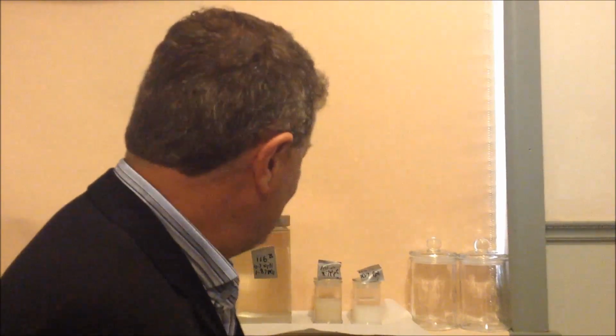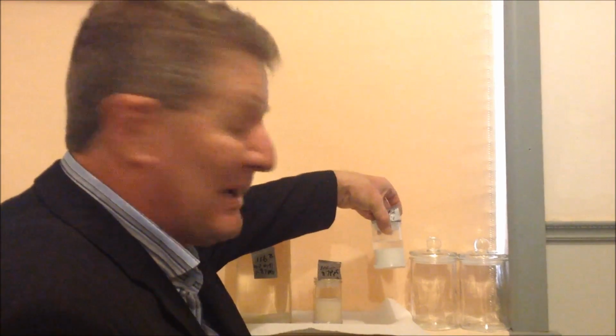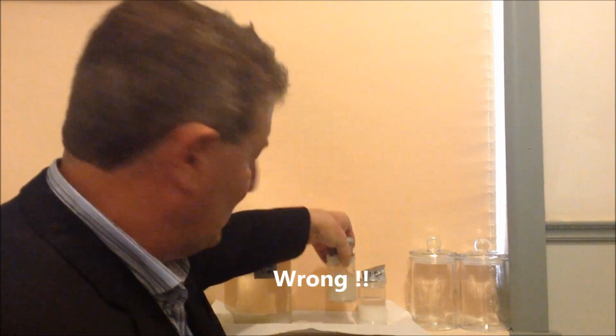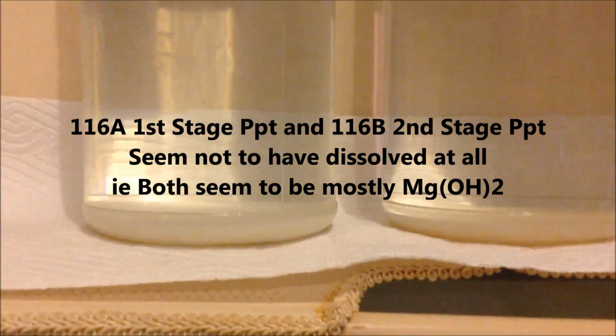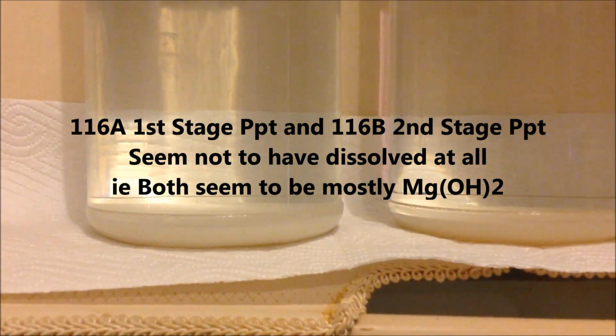What do we expect to happen? I really don't know. I suspect much of this will not dissolve, and I suspect most of this will, if not all. And so then we'll be left with, what is it? As you can see, A's on the left, B's on the right. I don't believe that's got rid of any of the precipitate.